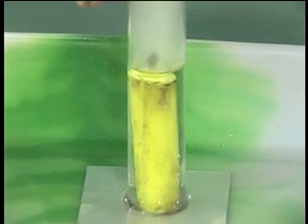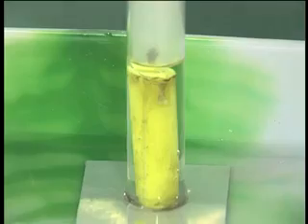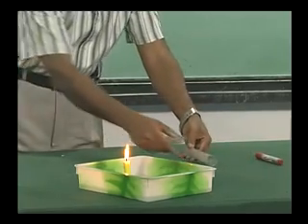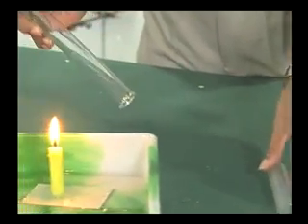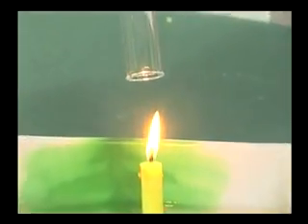The experiment is repeated with the longer tube. Since the longer tube has more supply of oxygen, the rise of water in this tube is more.